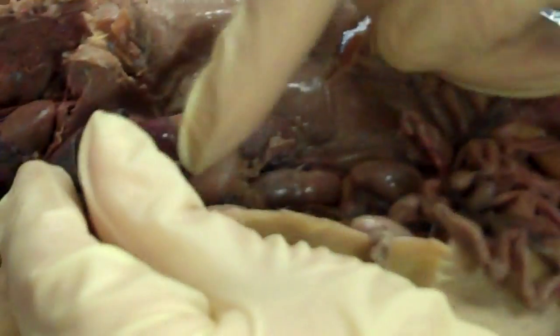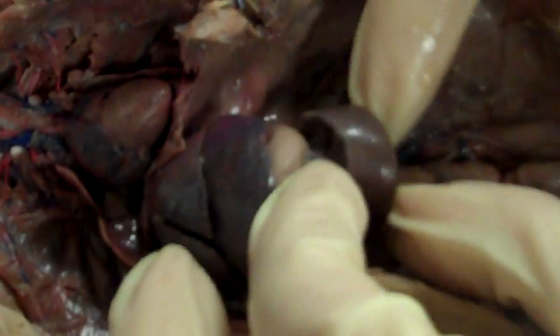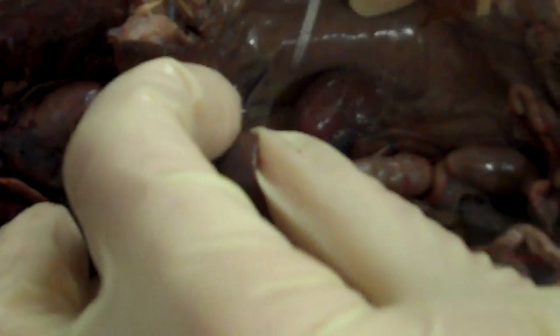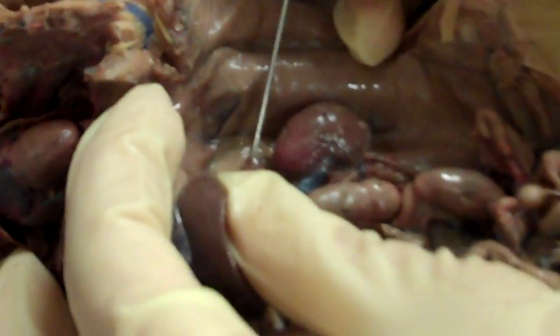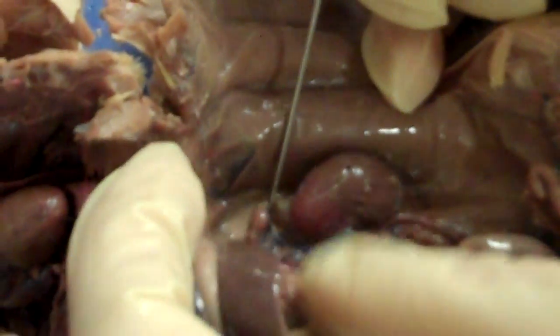Underneath the stomach, you find the spleen right here. And underneath the spleen, the kidney — this is the left kidney. The adrenal gland is embedded in the fat just above it.